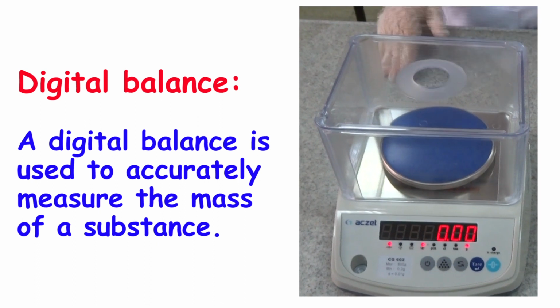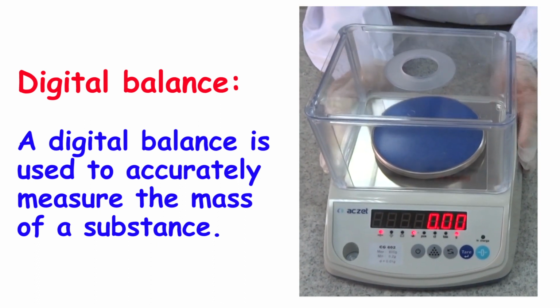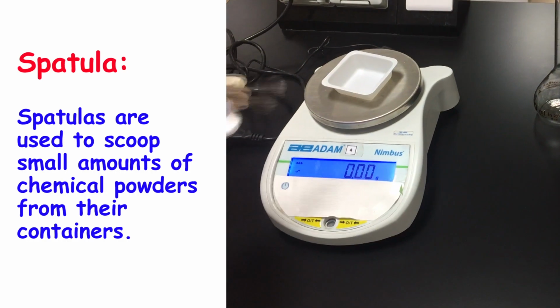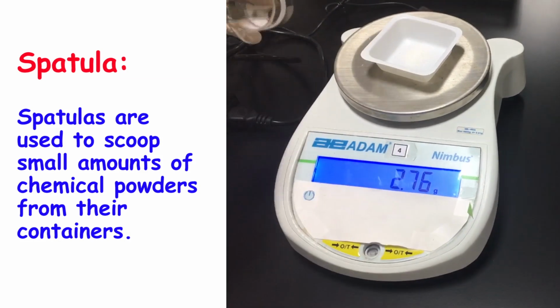A digital balance is used to accurately measure the mass of a substance. Spatulas are used to scoop small amounts of chemical powders from their containers.